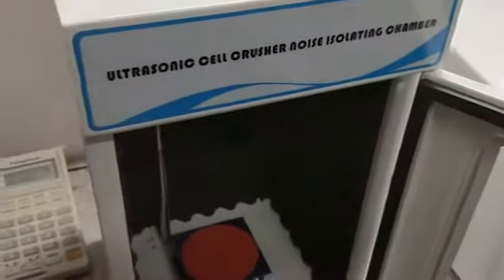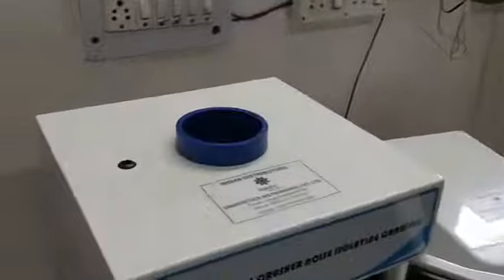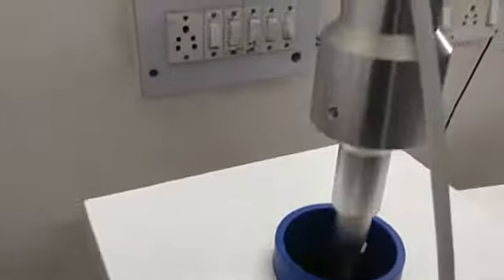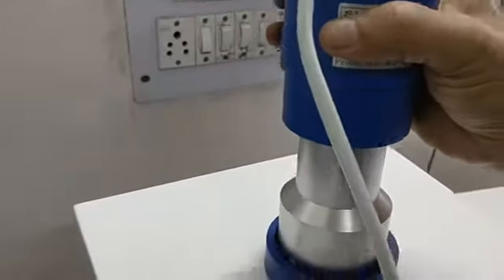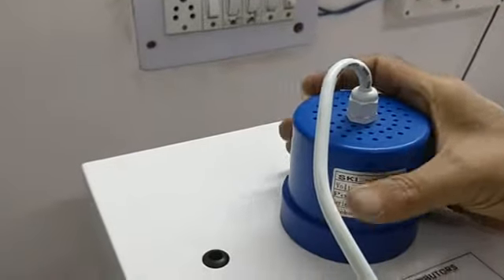We have fixed our 2mm probe on the transducer. Now let us see how to fit this probe and transducer on the machine or sound reduction box. This is very simple. We just have to simply slide it from this opening on the top, and it will rest at some point.